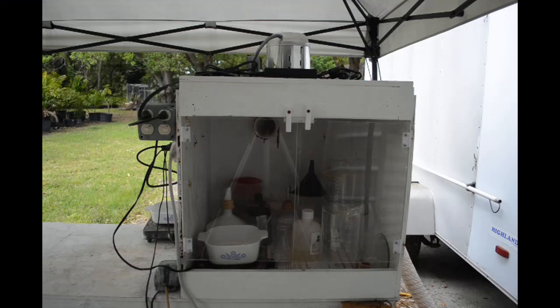Hello YouTubers. Well, it's been a while since I've talked about my fume hood and I thought I'd give you a little bit of an update on it.